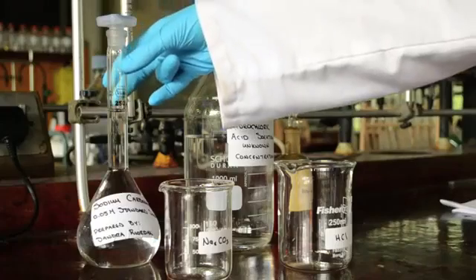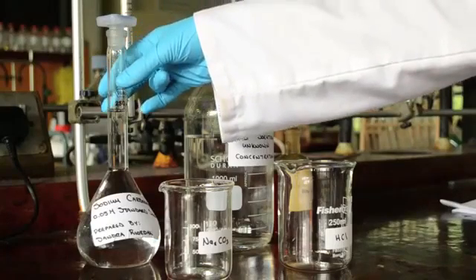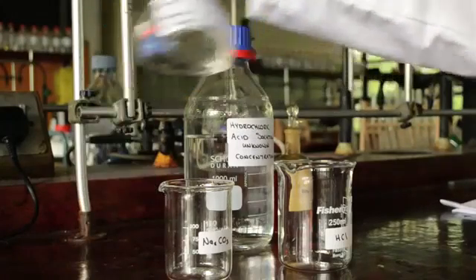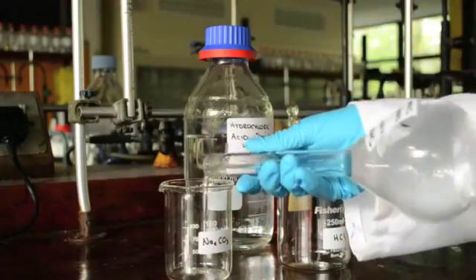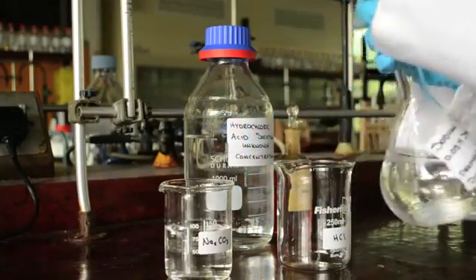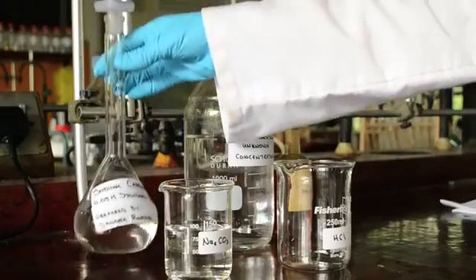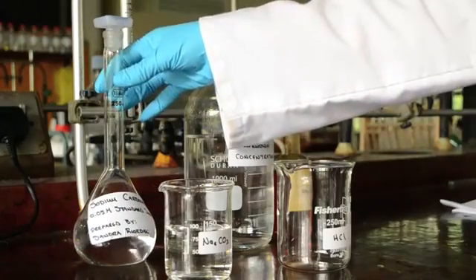I'm going to take about 100 ml of my sodium carbonate standard solution and pour it into a clean, dry beaker which I've already labelled sodium carbonate. The reason for this is so that I don't contaminate my stock solution, standard solution of sodium carbonate.